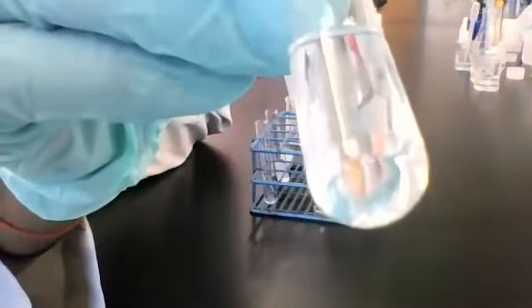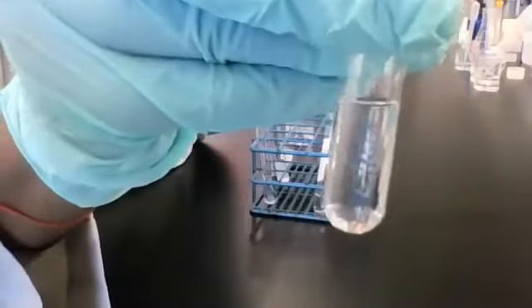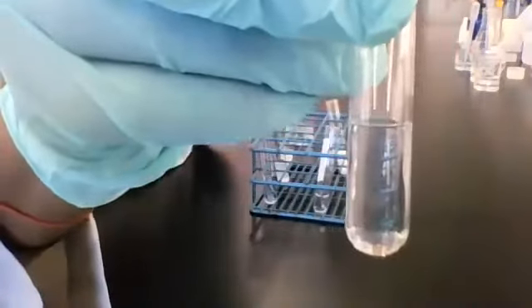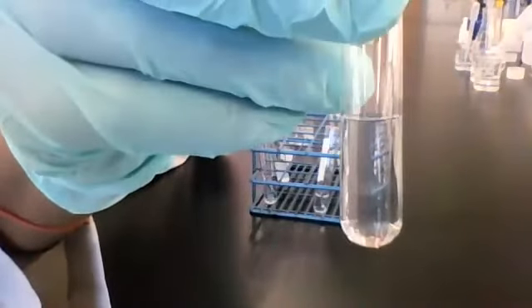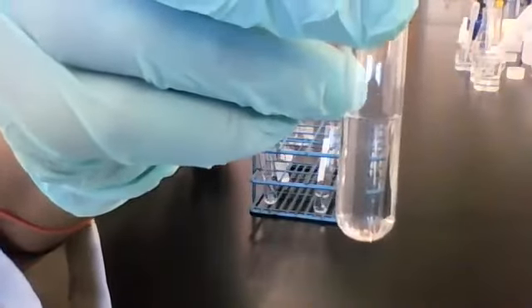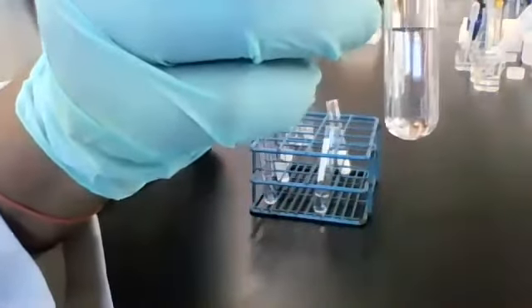All right, so we see it, hopefully. Nothing at the bottom of the tube here. We've been predicting what will happen when water dilutes an aqueous solution. So you write your observations here for solution 5 combined with reagent C.